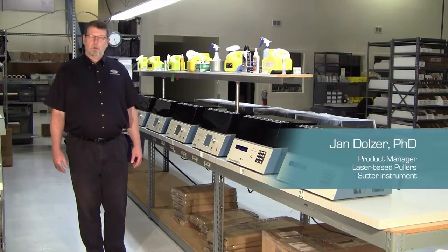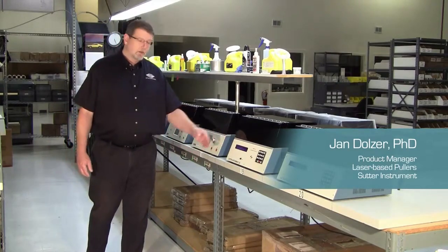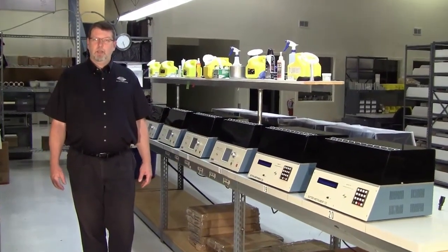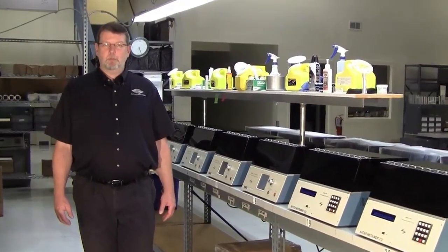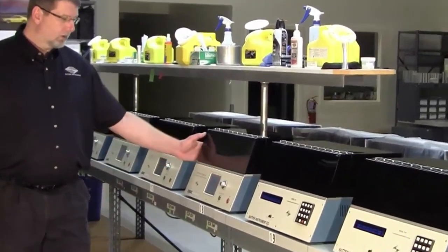This is a short tutorial about checking the pull cable adjustment on your Sutter P97, P1000 or P2000 puller. A pull cable that has detached or is not properly adjusted is one of the factors that may cause variability in your pull results. So our tech support will ask you to check the adjustment of the pull cable and probably a few other components.